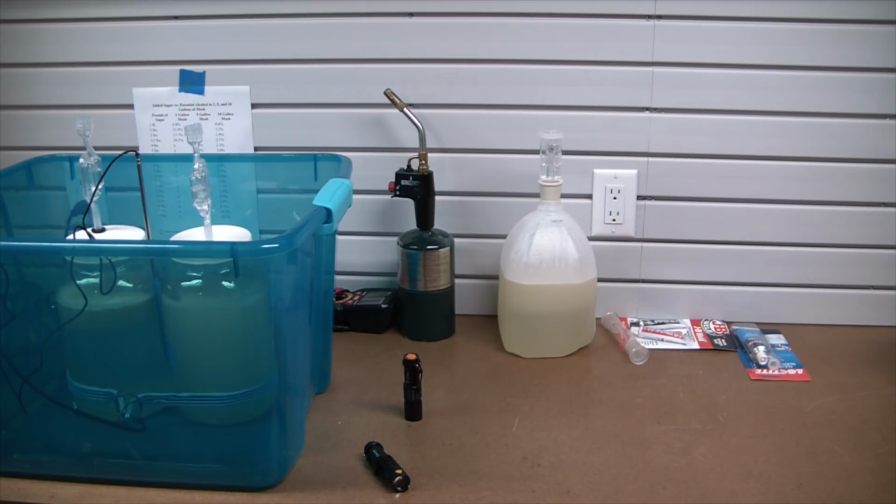Today, as you can see, I have 3 gallons of sugar wash fermenting. The goal here eventually is going to be going from sugar to anhydrous ethanol. But in order to do that, I need a still.